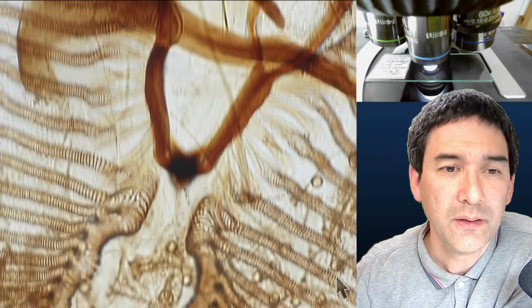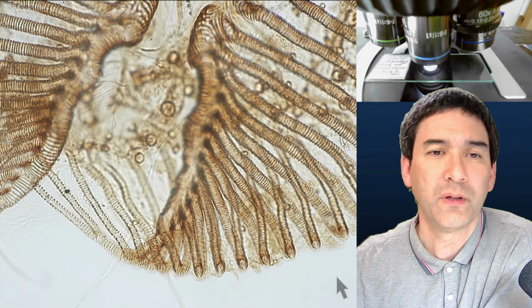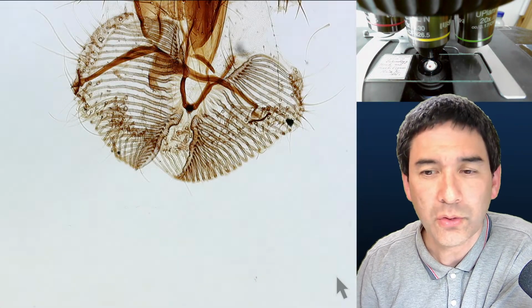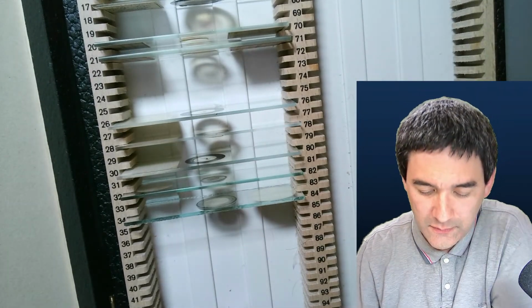And here, that's basically the front part of the bottom part of the mouth. So it's a really nice slide. Okay, but I think I did not make a video of this. So let's move on to the next one.